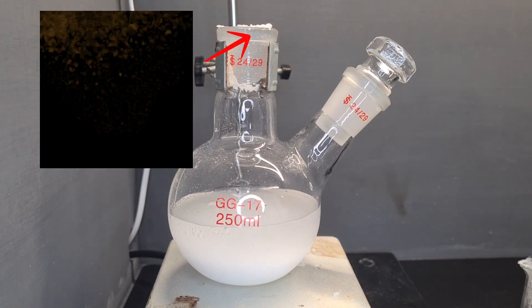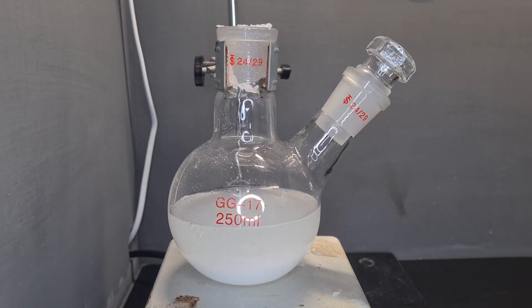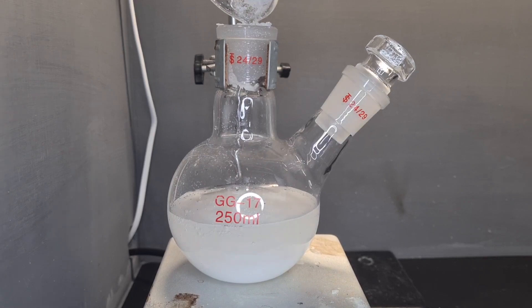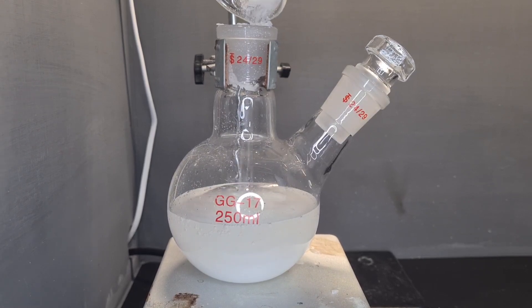And I definitely didn't spill it everywhere and cut out the part where I did. Anyways, the good thing about this reaction is it does not start producing ammonia until you heat it up.